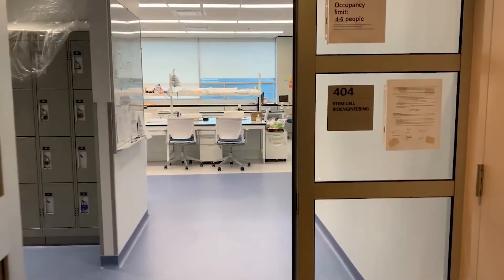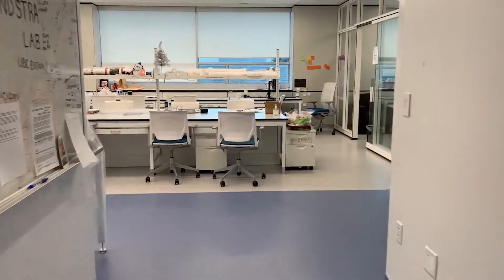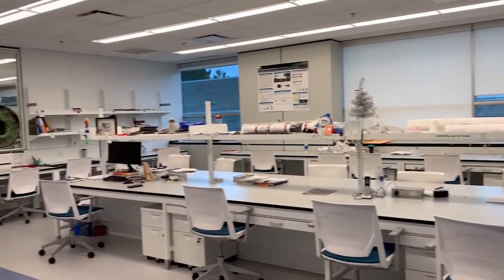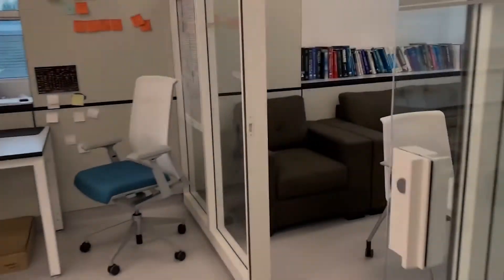Hello! Welcome to the Stem Cell Bioengineering Lab here in the School of Biomedical Engineering at the University of British Columbia, where students are trained in the fundamentals of both biology and engineering.